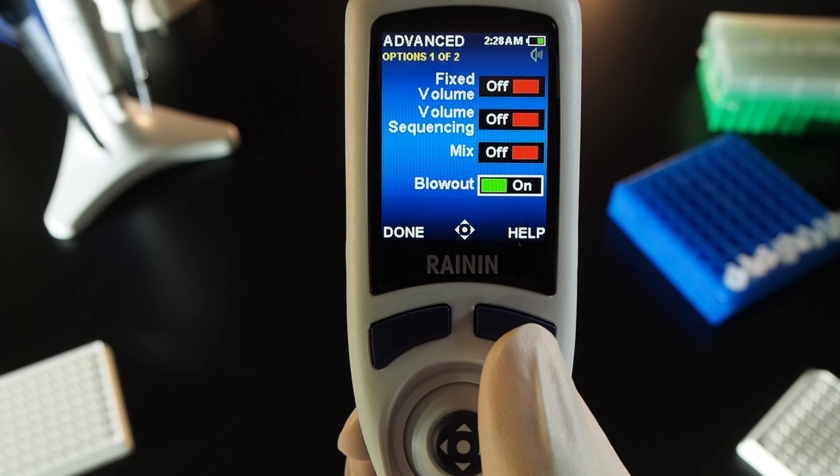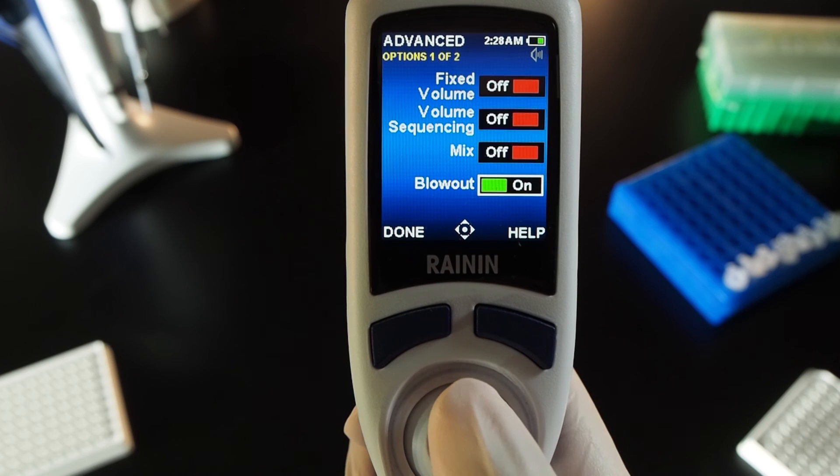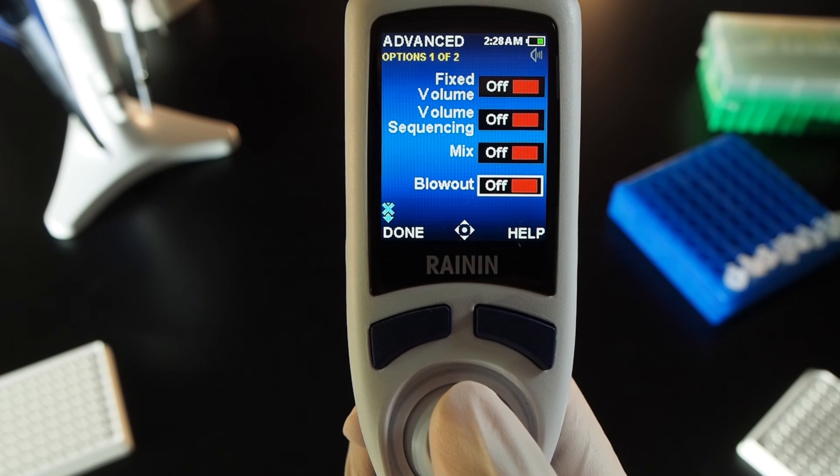Turn blowout on or off. In options, joystick to blowout and press the joystick in to enable or disable blowout.